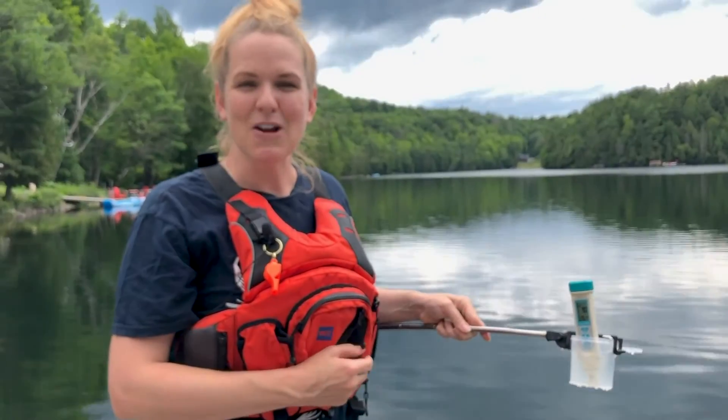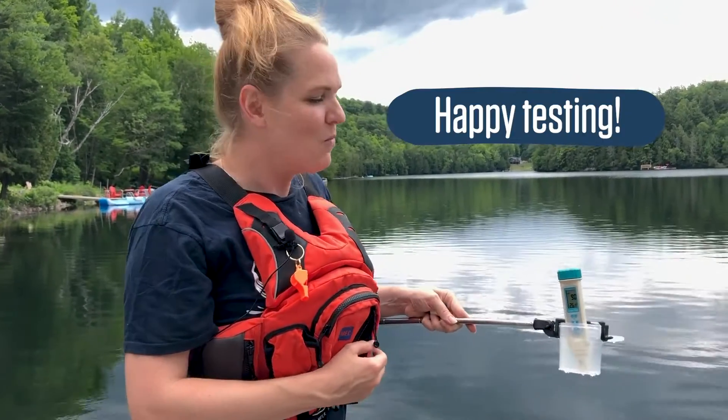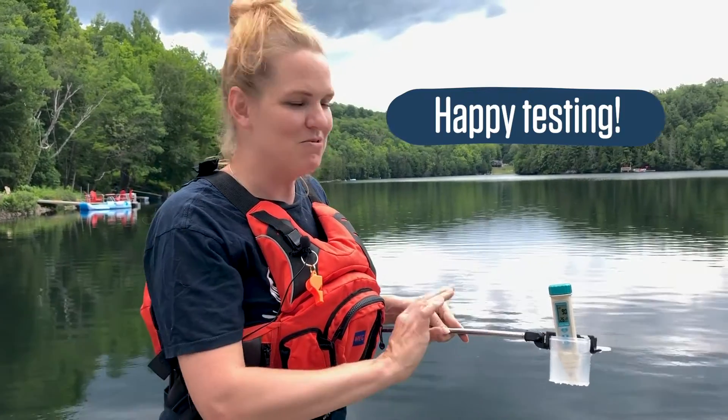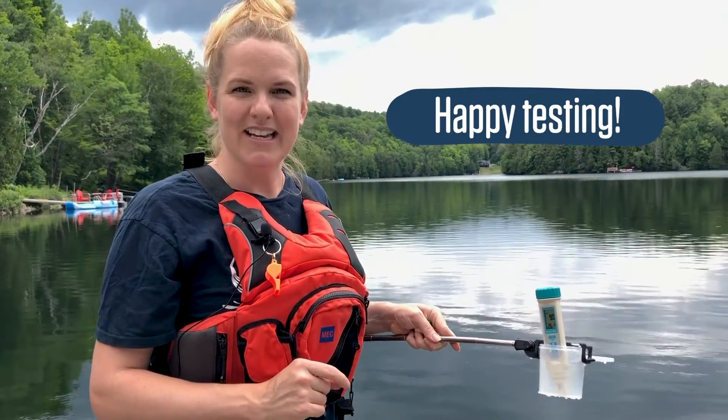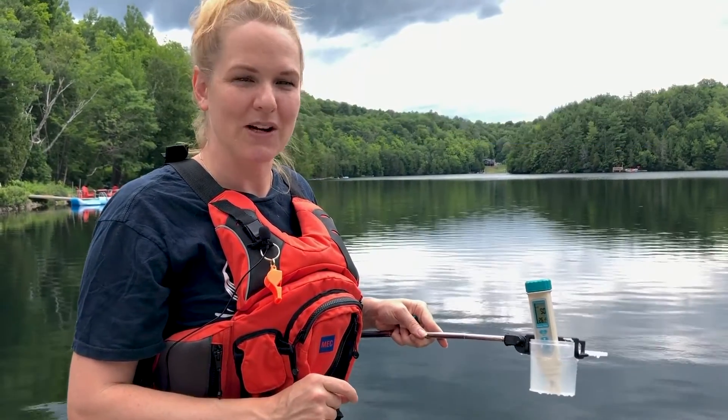Every body of water has its own normal value, so you want to make sure that you do this regularly to understand your water body's health.